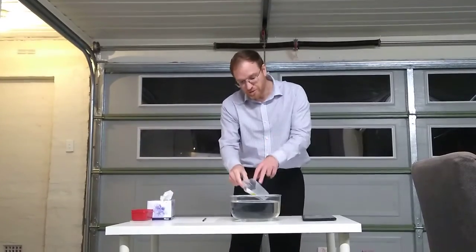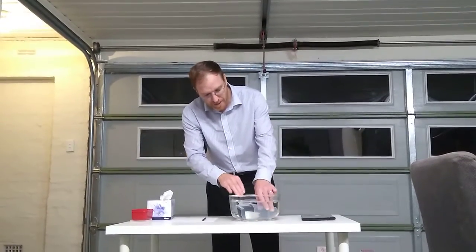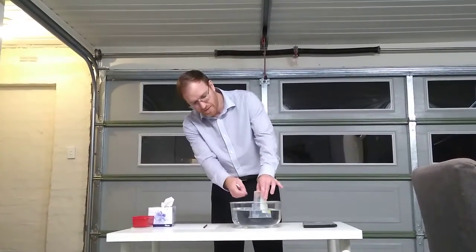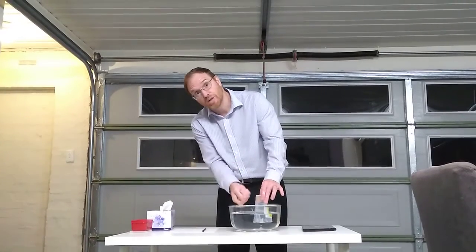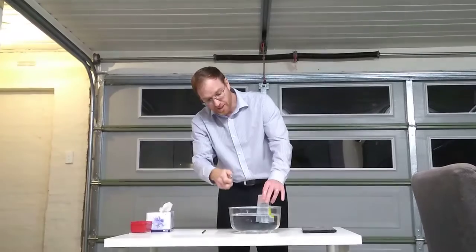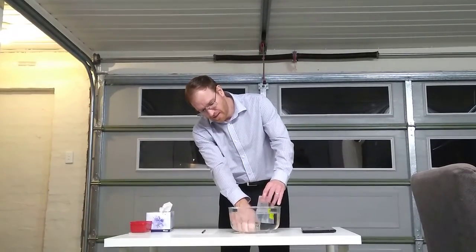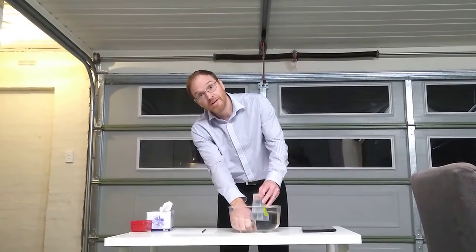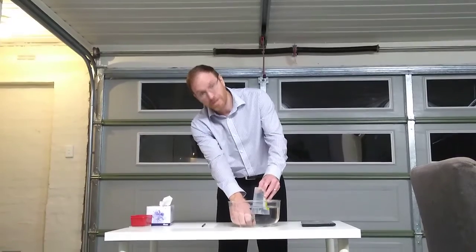Then I want to take some gas out of it, and I want to know exactly how much gas came out. So a simple way to do it is I've got a container full of water. I put a measuring cup in there, or a measuring cylinder if I had one, and I've turned it upside down, but the cup is full of water. So if I release some gas under there, it will go up into the cup and I'll be able to measure the volume. I'm now going to take my cigarette lighter, I hold it under there and I release the gas. You may not be able to see it on the video, but there are bubbles going up. They're coming out of the cigarette lighter and I'm capturing them in the measuring cup.